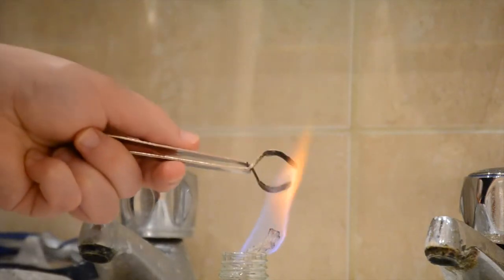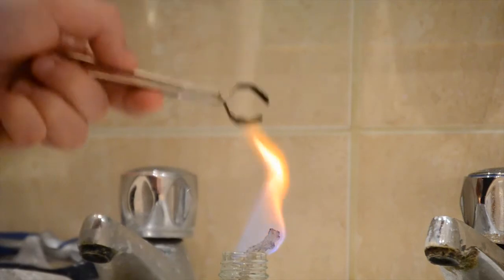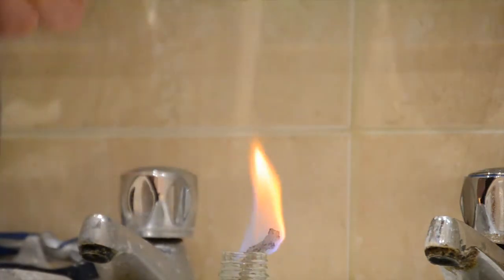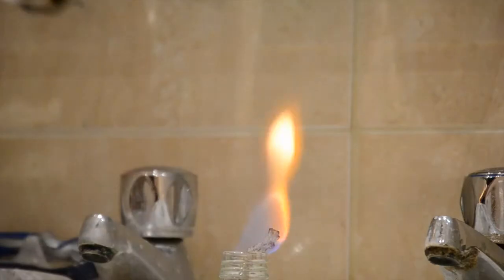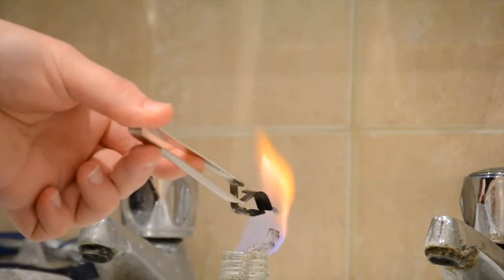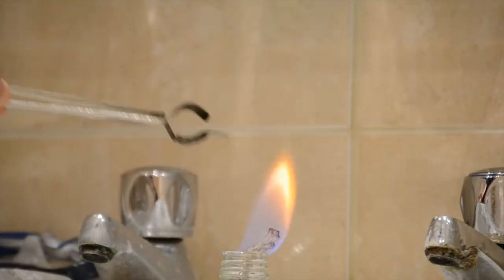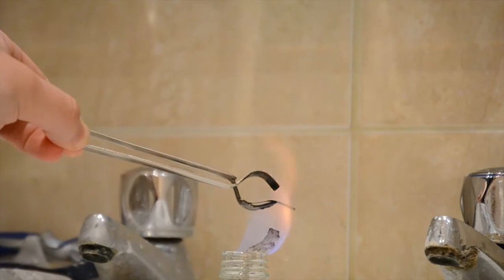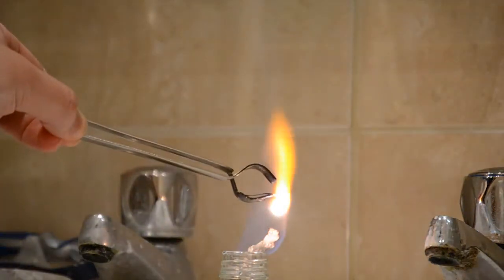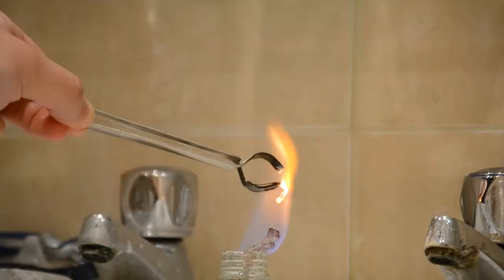First into the flame are the iron filings, with a glorious golden energetic spark. Next we have the Magnesium Ribbon. This burns vigorously and can be painful to look at with a naked eye. In fact, the flash causes me to drop the ribbon the first time. And now I repeat the experiment with the camera set to a much lower light sensitivity.